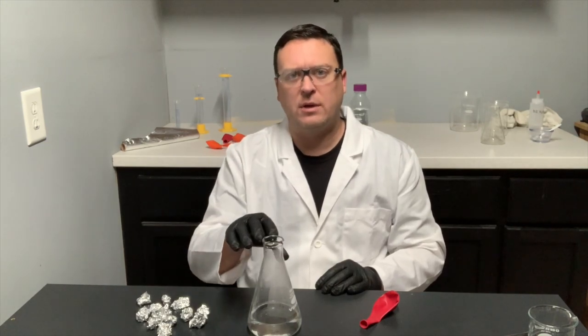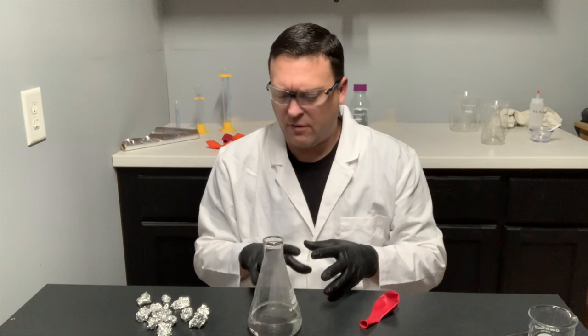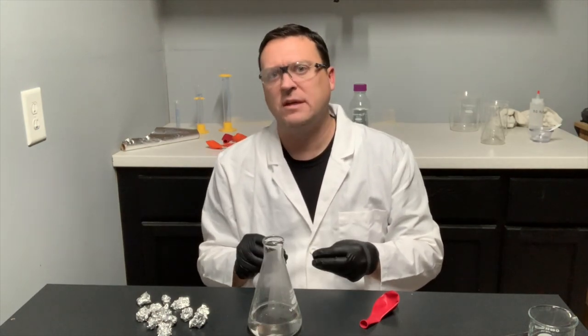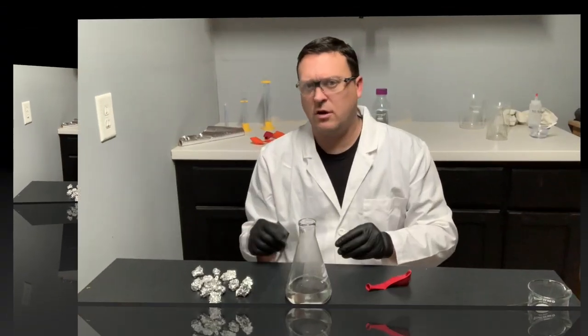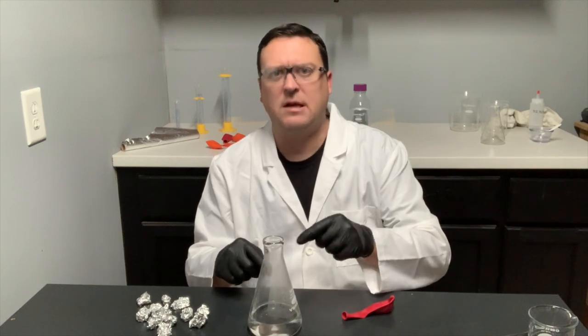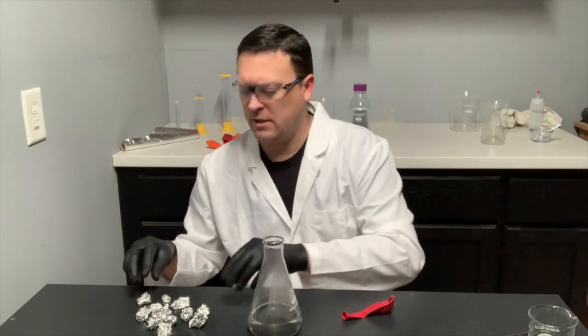All right, so once I add the aluminum to our solution, this will start the reaction. Now, this is an exothermic reaction, which means it will generate some heat. To get started, I'm going to add the aluminum, put the balloon on top to capture that hydrogen, and we'll get going. Here we go.